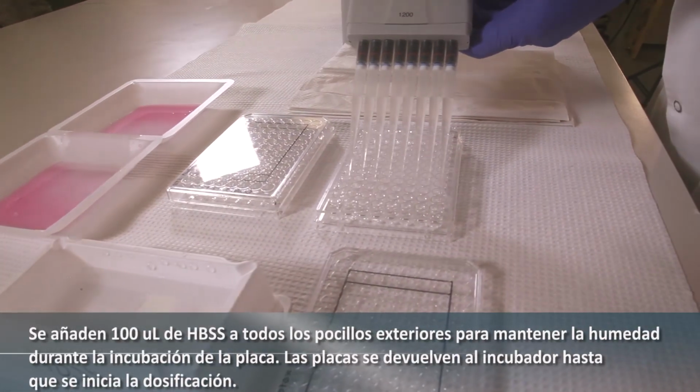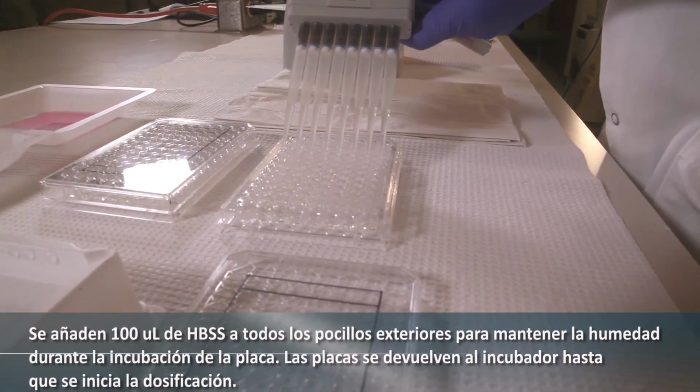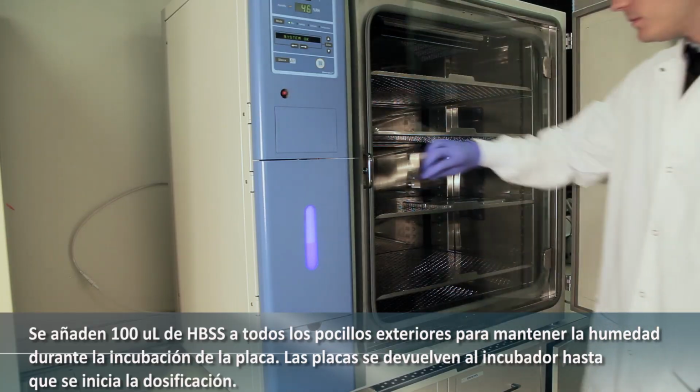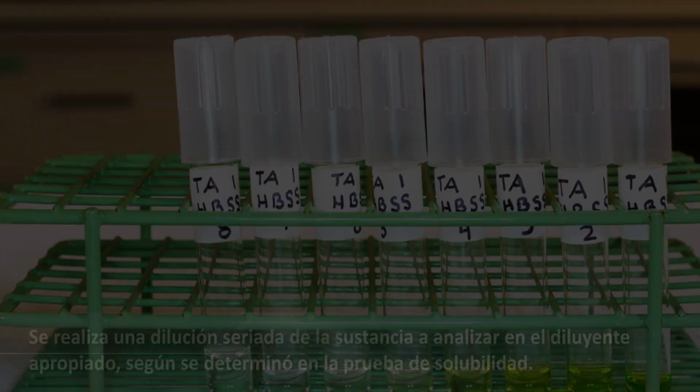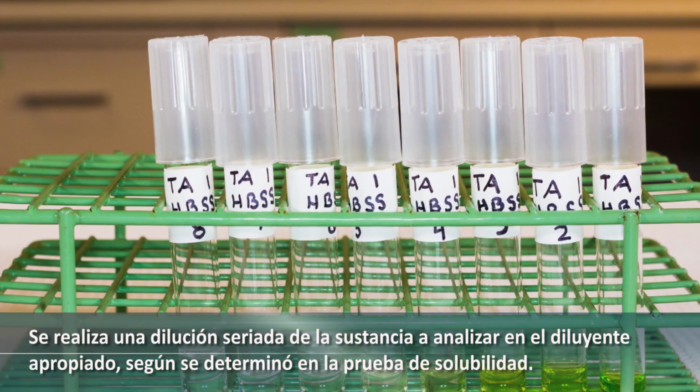100 microliters of HBSS are added to all outer wells to maintain humidity during plate incubation. The plates are returned to the incubator until dosing is initiated. The test substance is serially diluted in the appropriate solvent as determined in the solubility test.